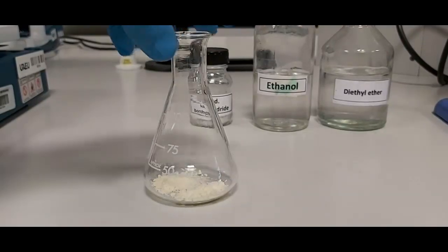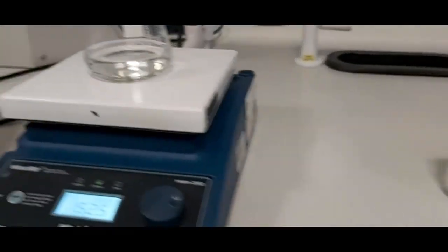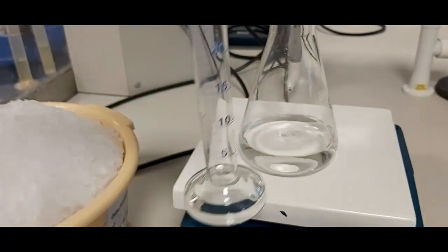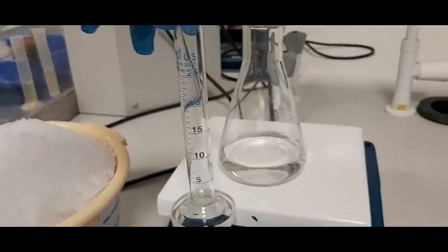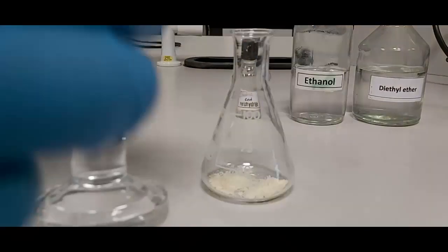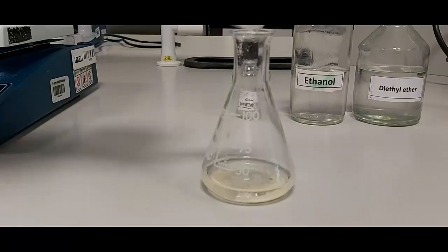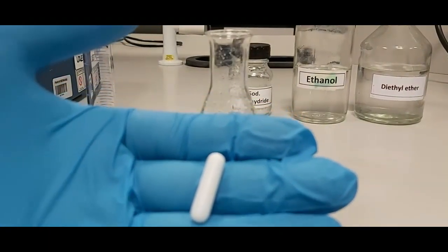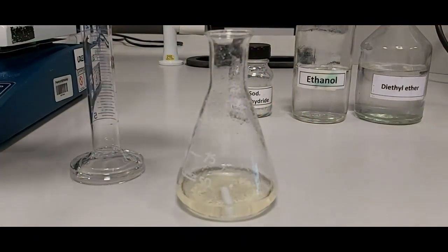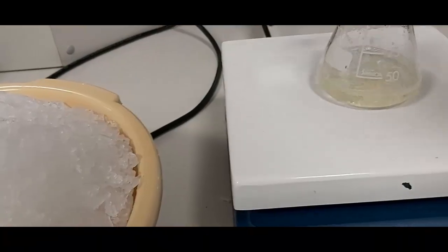Then I will add 20 ml of warm ethanol. I already put the ethanol on the hot plate to warm. I have the warmed ethanol here and I take 20 ml using a graduated cylinder. I then added it to the acetophenone and added a magnetic stir bar.